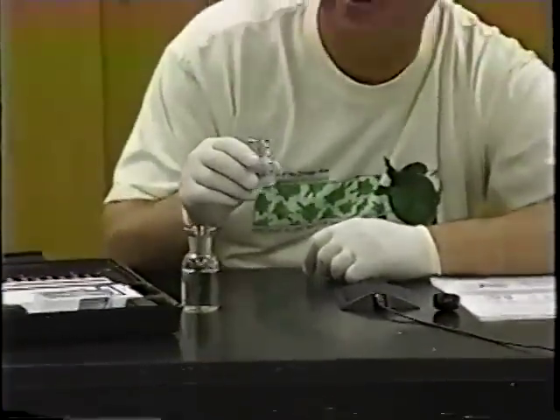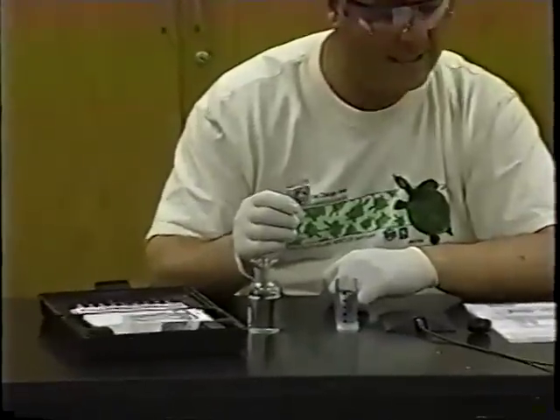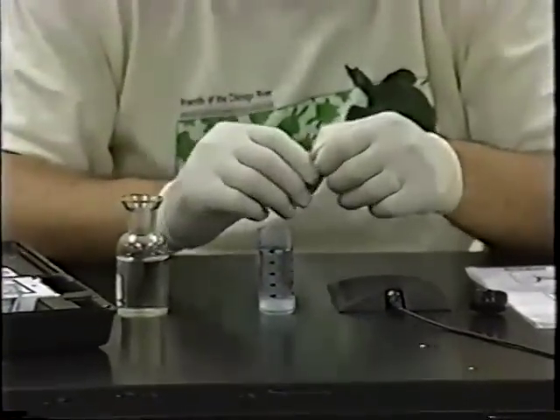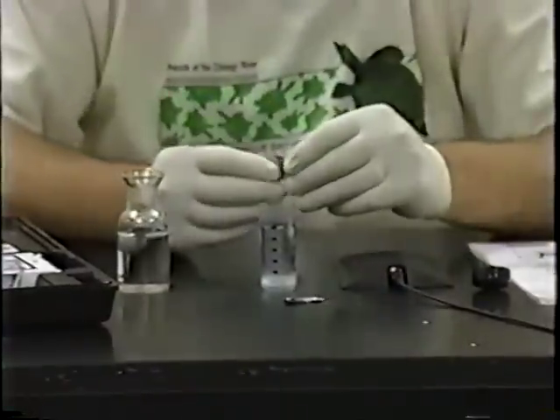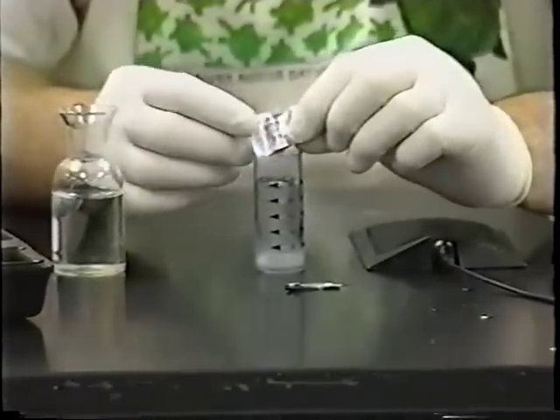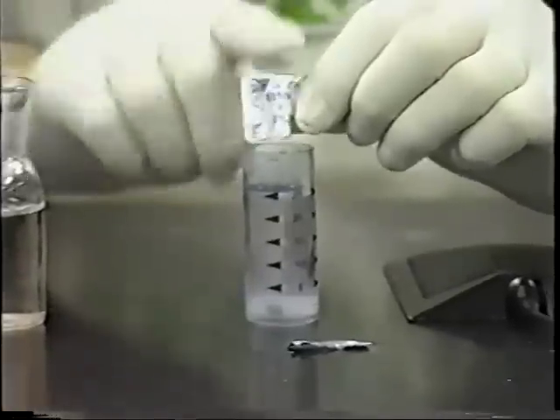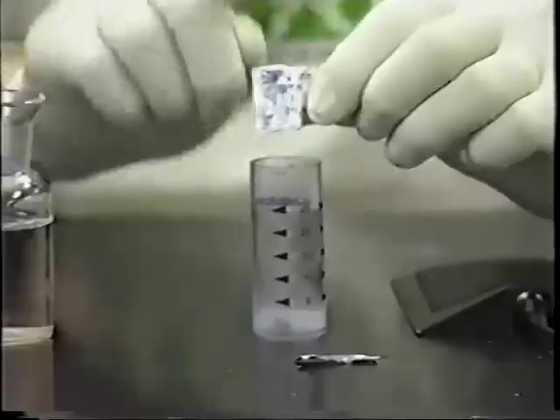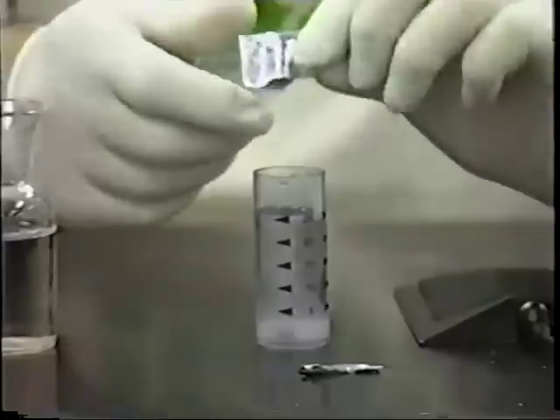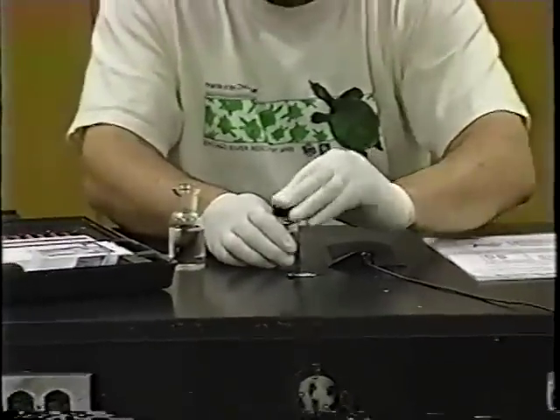I've got 25 milliliters of water filled right to that point. Next, I'm going to take the contents of one of the foil packs and empty the contents of one foil pack into the sample cup. This is a nitrate sample foil pack that has some chemicals in it. I'm going to open this up — there's a powder in there and you want to get most or all of it into the cup. It's important that you start to time once you put that chemical in. You'll need a stopwatch or a watch with a second hand, because you want exactly three minutes of shaking this vigorously.